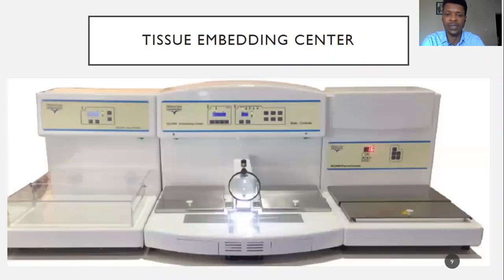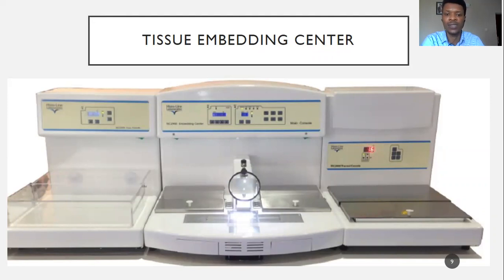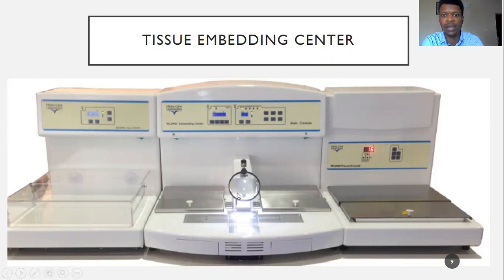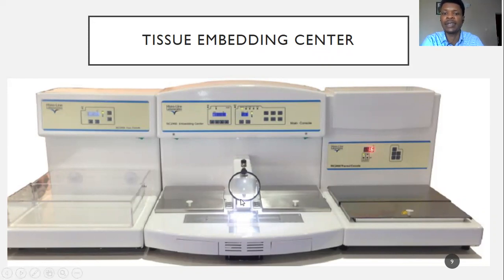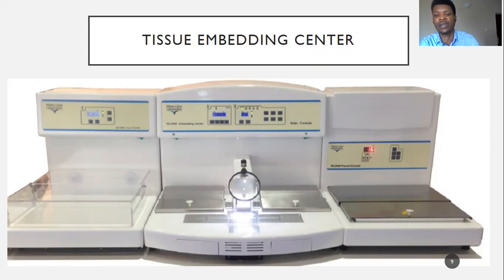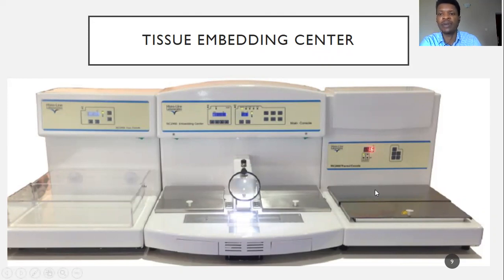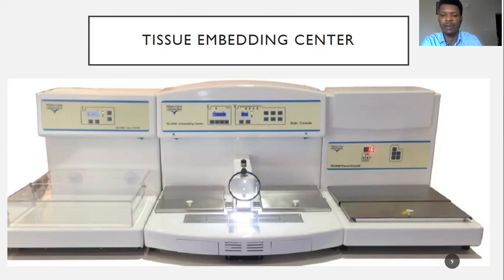This is an embedding station. This nozzle here is where molten paraffin will come out and fill up the cassettes where the tissue is. Afterwards, it's placed in the oven and allowed to impregnate properly, then allowed to cool down.